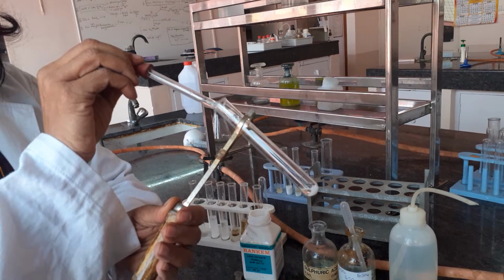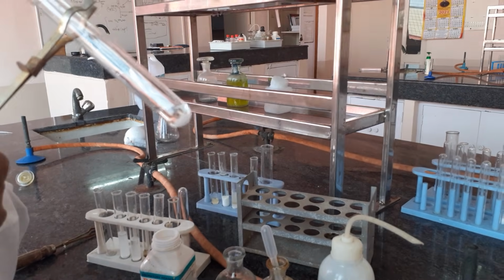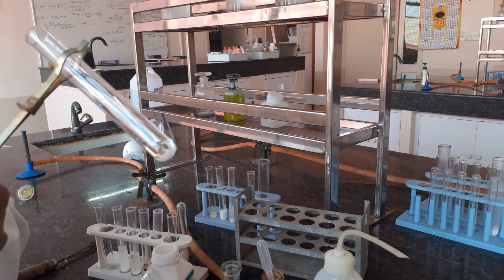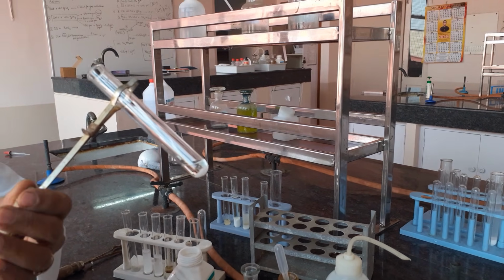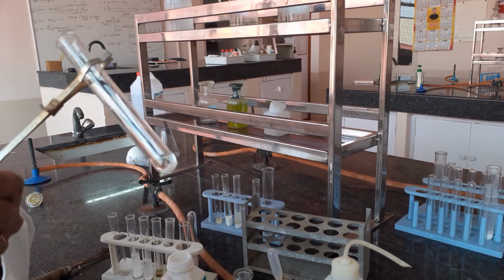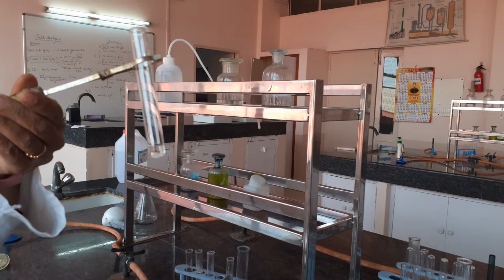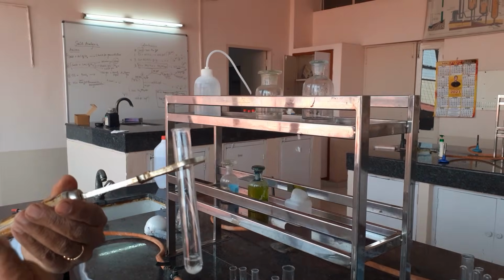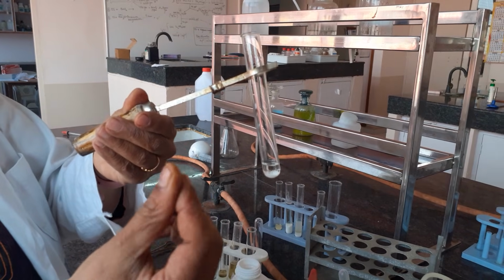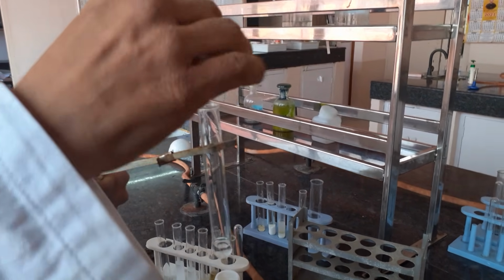Try to observe, are there any bubbles? Have a close look. Can you see any bubbles coming out? No, which means there is no gas evolved, which means it does not have chloride, bromide or iodide. At this point you will put a piece of paper. I am just taking any piece of paper, a newspaper or anything, making a ball out of it and then putting it in the test tube from the center.